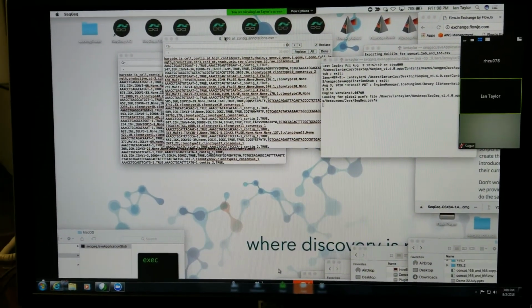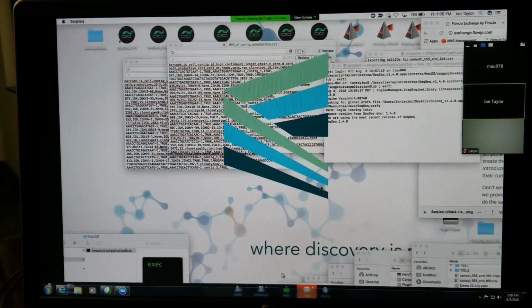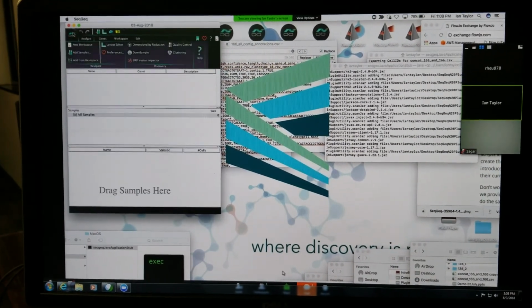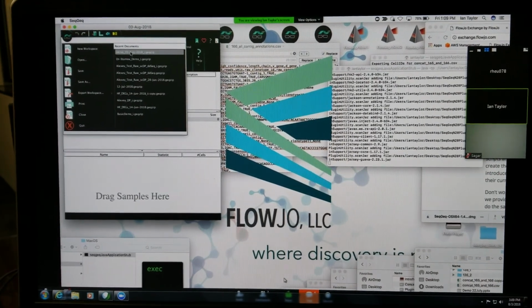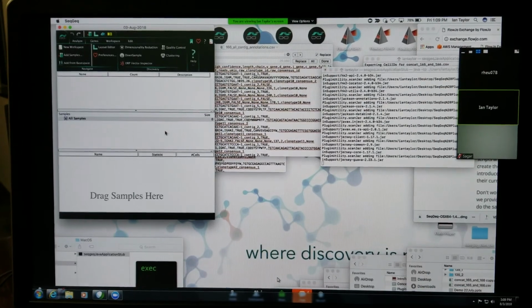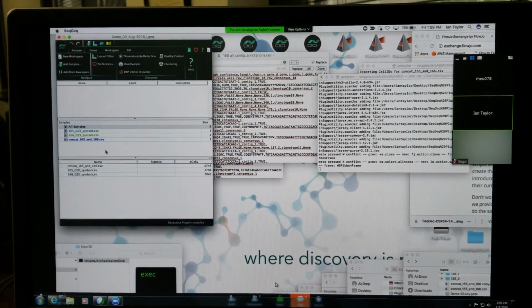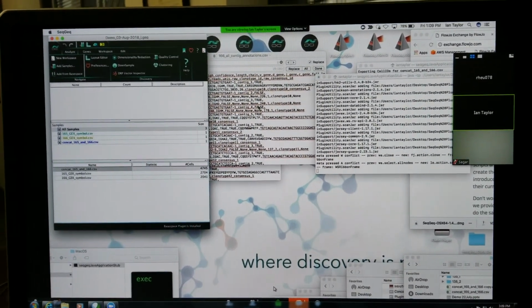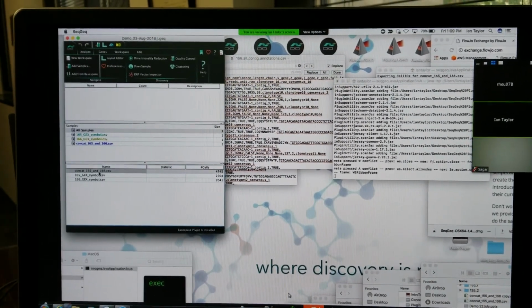And signing in through the FlowJo Portal account, I should be able to open up SeqGeq. And then I'm going to open up my saved workspace, which is this demo for today. There we go. Then I want to see if I've managed to make the barcodes in the annotation data match with the raw concatenated data.